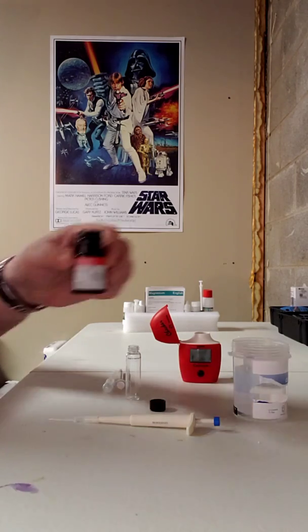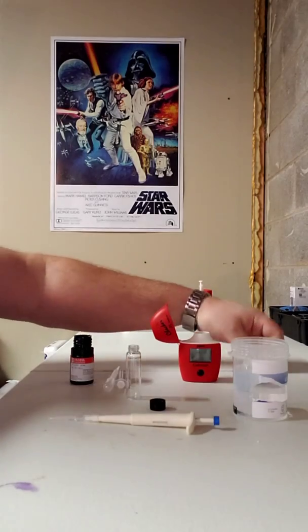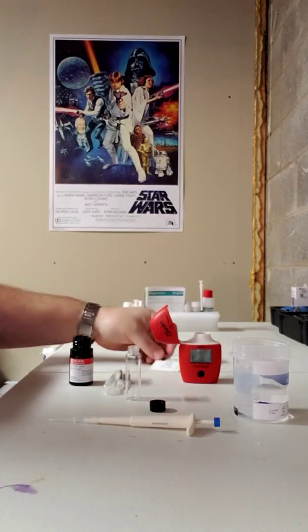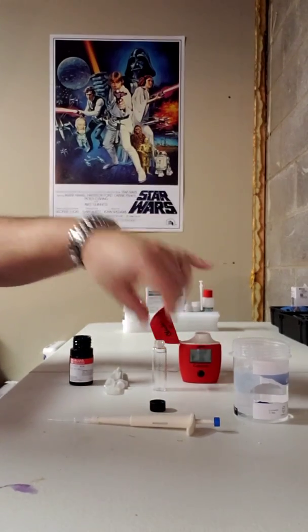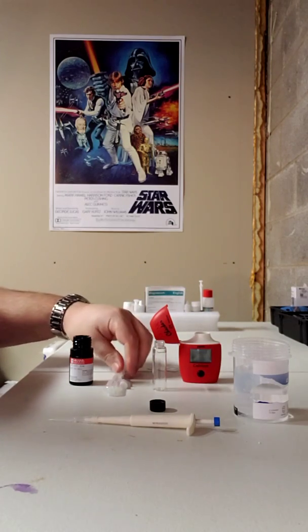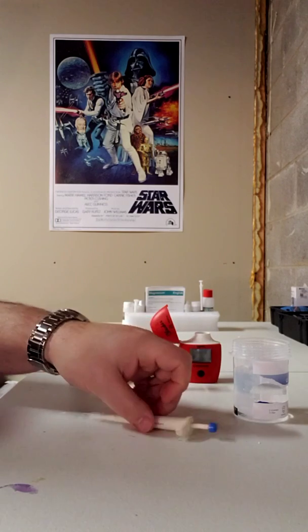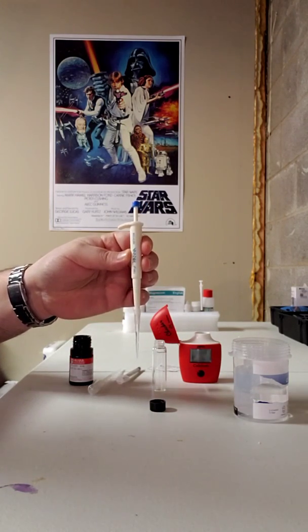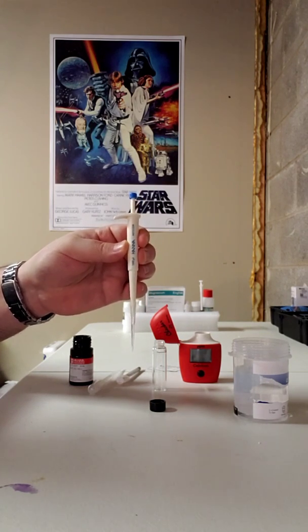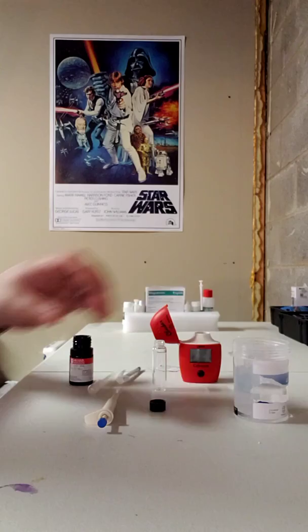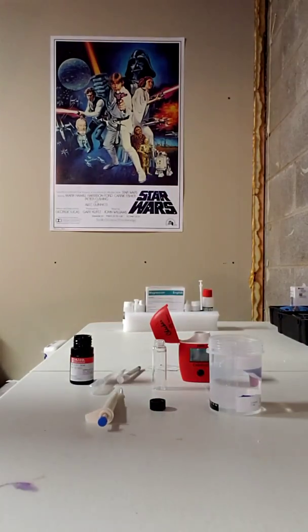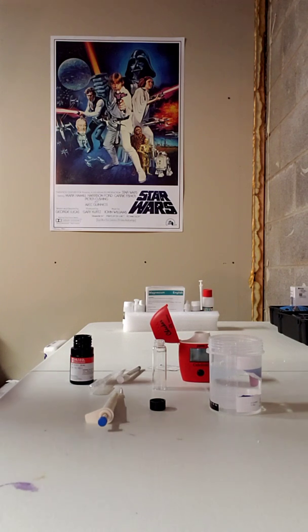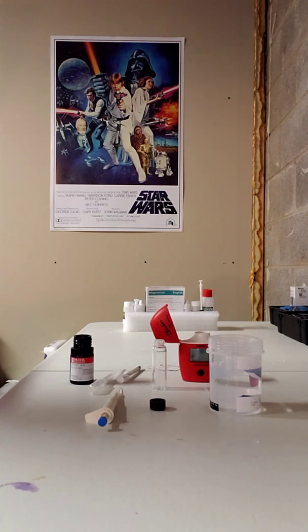So what you're going to need is the Hanna reagent, which there's a liquid and there's a powder. They send you the little bottles that you test your water in, a pipette, a 1 ml syringe, and a 100 microliter pipette. You're also going to need some fresh water. I have used RODI water since the beginning. Some people also say you should use distilled water, but since I started with RODI water, I'm going to continue to use RODI water. That way I'm getting accurate measurements and the same readings all the time.